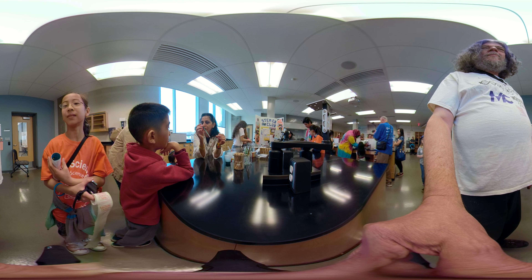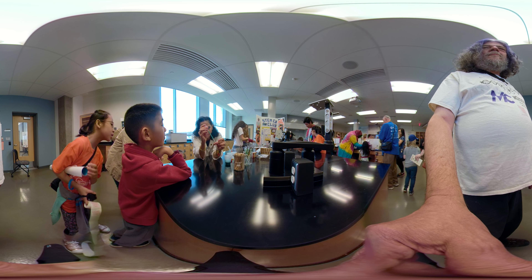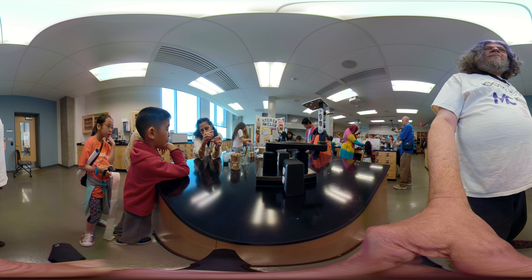There's a special way of putting it in. I'm doing a blue now. Look for the blue — I'm going to go to the very bottom and do it very carefully, otherwise they're going to mix. Do you see the blue developing at the bottom? Cool, isn't this cool?